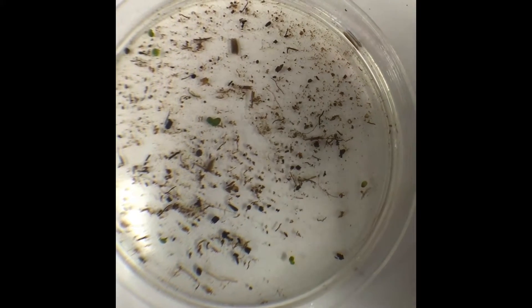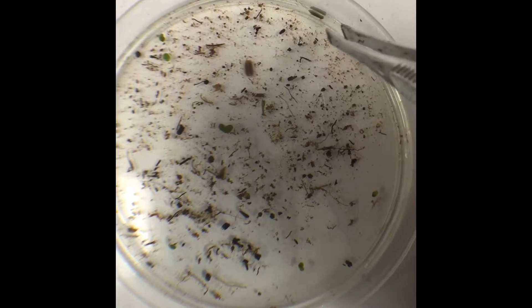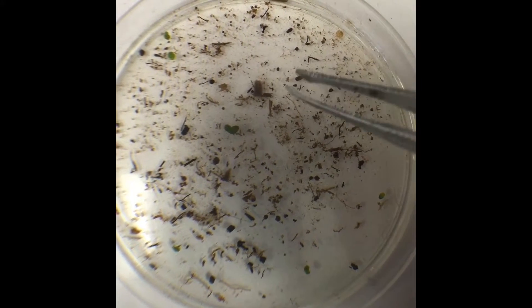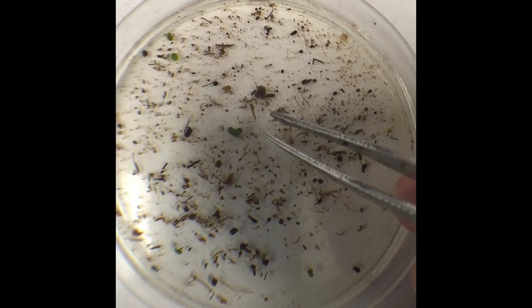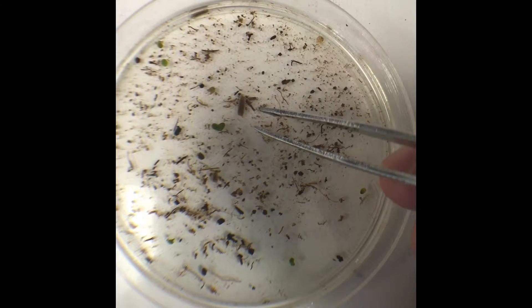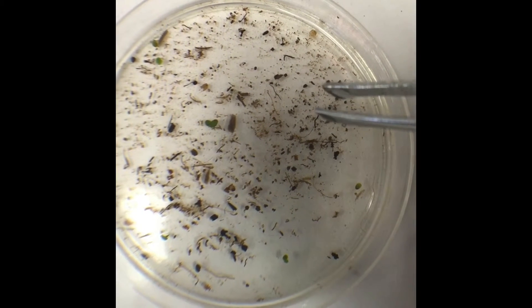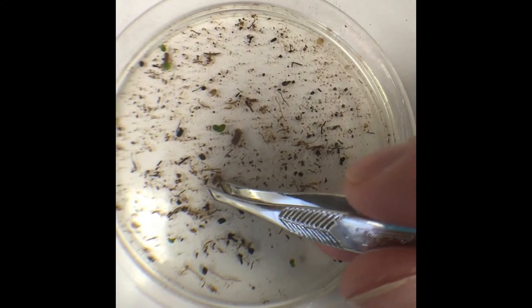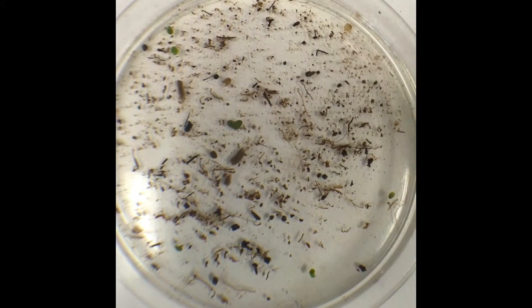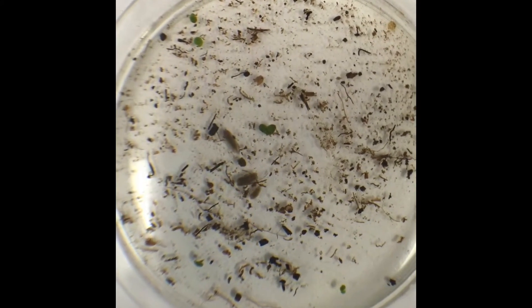24 hours after I cut my planaria into unfortunately three pieces, you can see that the part with the head is doing very well. It's still doing what it did before, moving around — the head's still in control. The other pieces have not moved as much. Here's what looks like the midsection and here's the tail. The middle section is alive and moving, responding to stimuli, and the tail section is also responding to stimuli. The experiment is working — the three pieces are exhibiting signs of life and they're almost coming together.